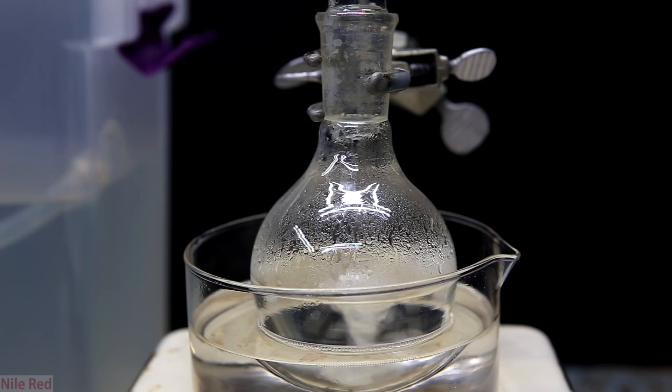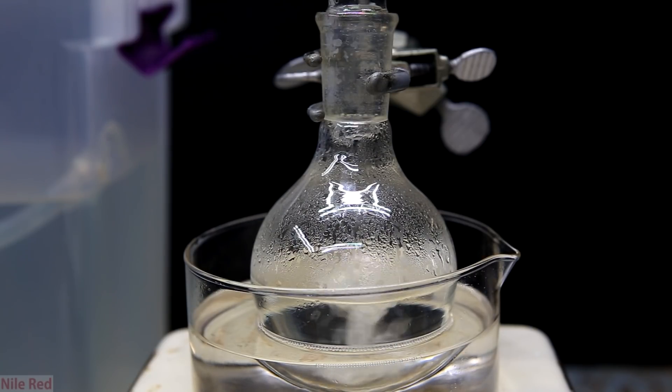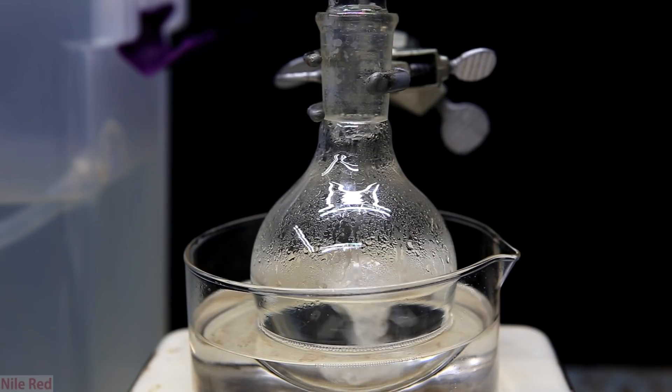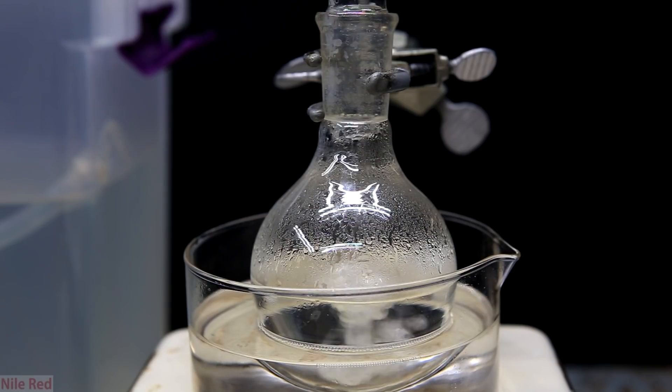Once the solution is brought to a boil we will obtain what's known as a reflux. The water will be boiling off but the water vapor will be recondensed by the condenser that we have above. This way we can heat the reaction to boiling without losing any of the water. By heating up the reaction we're greatly increasing the rate of the reaction.